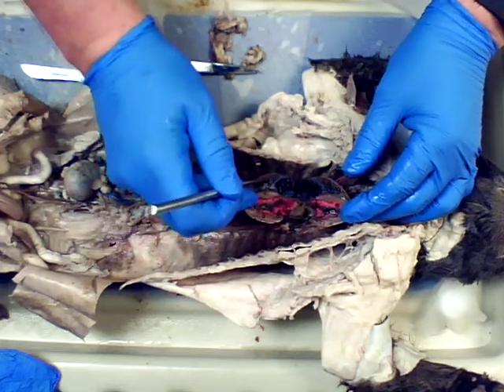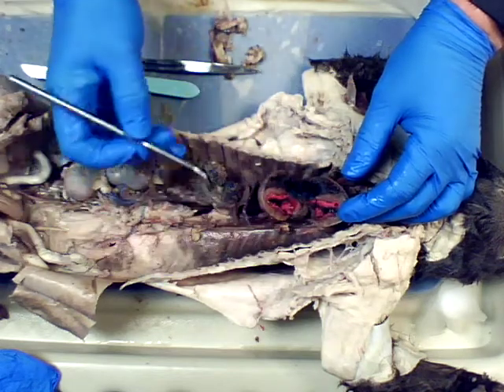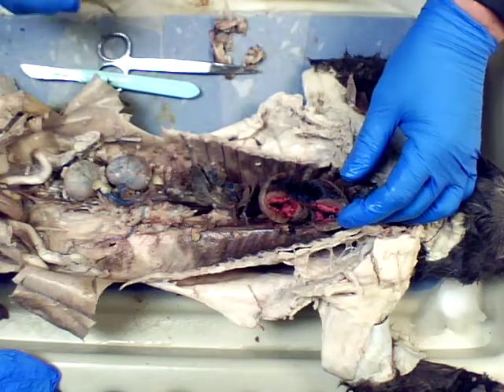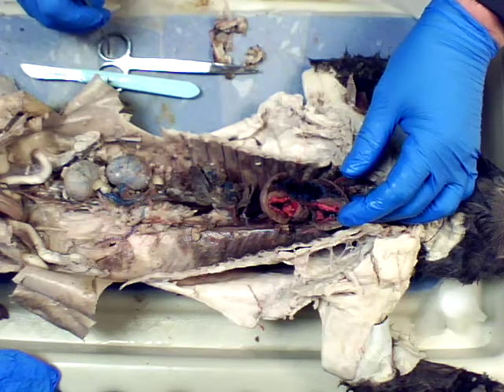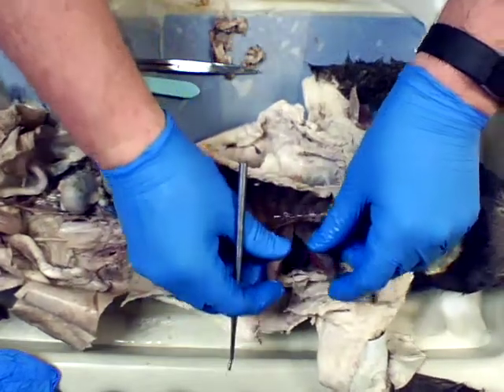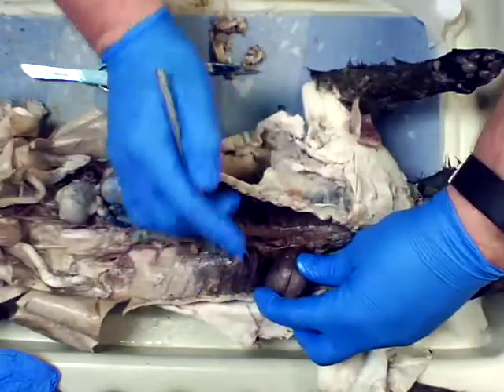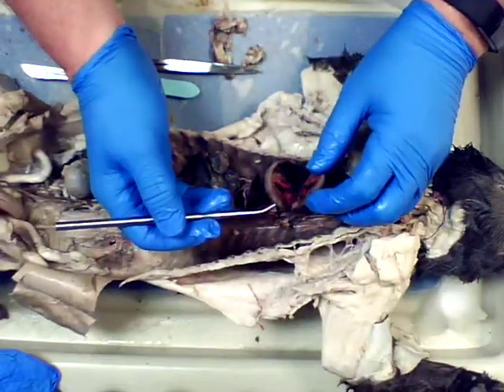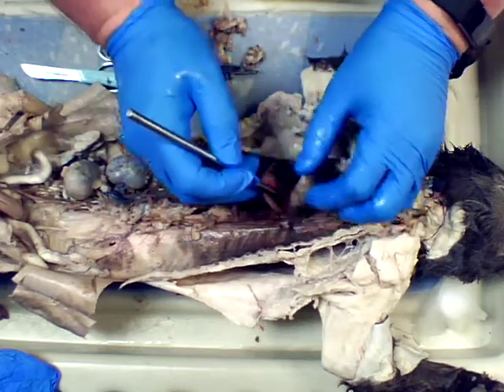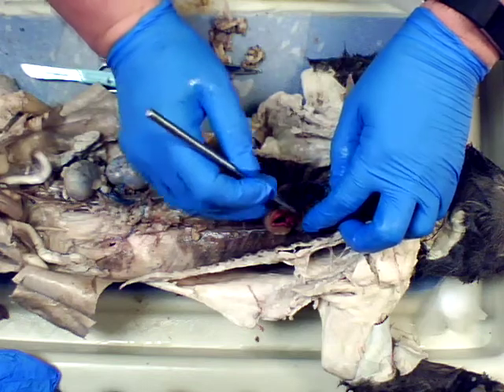This is the right ventricle of the heart. They will squeeze and send blood through the pulmonary arteries, because arteries always go away, into the lungs. So the pulmonary arteries would be blue, exiting here on the side. Then that will pick up the oxygen, drop off the carbon dioxide, come back into the left atria here, this very large mass that the scalpel wouldn't cut through.